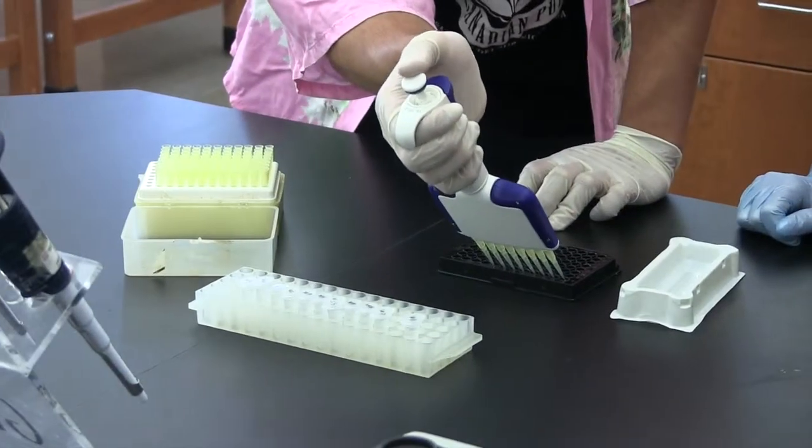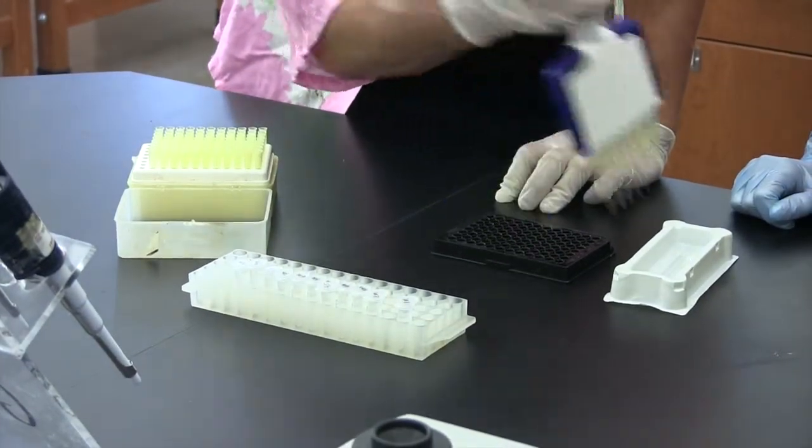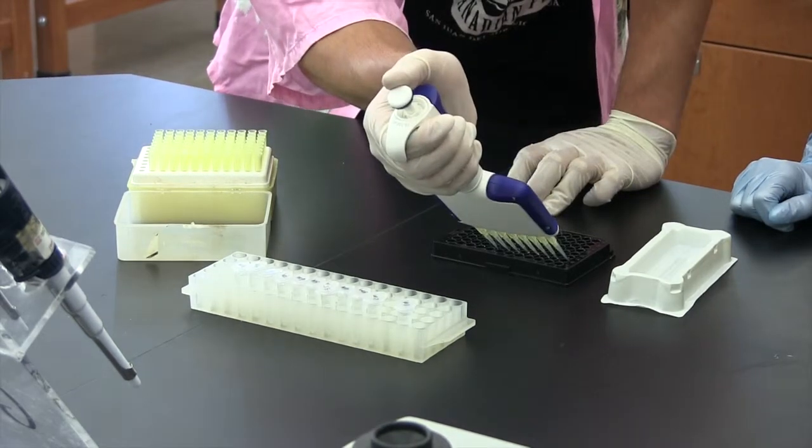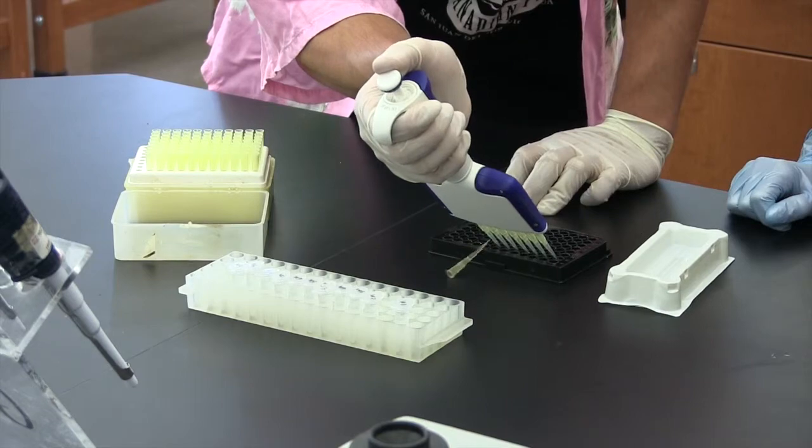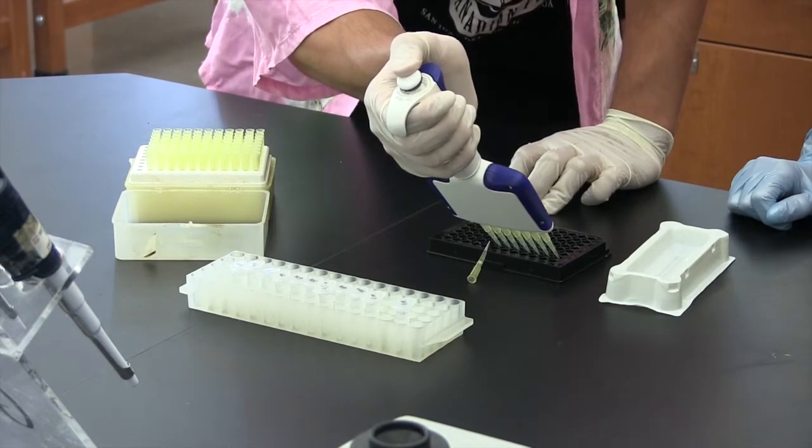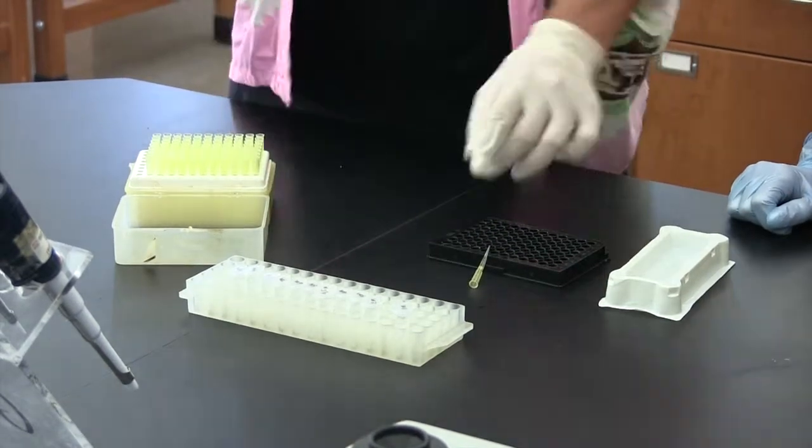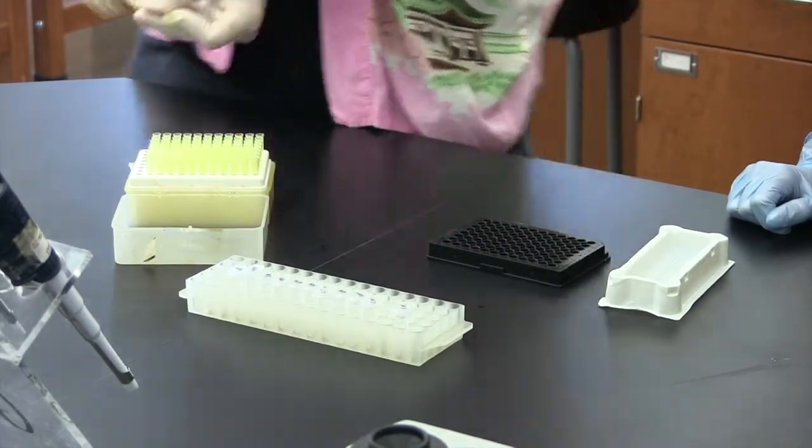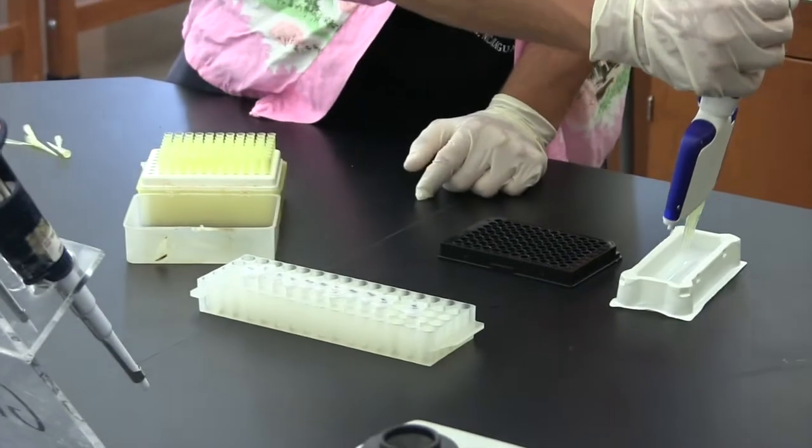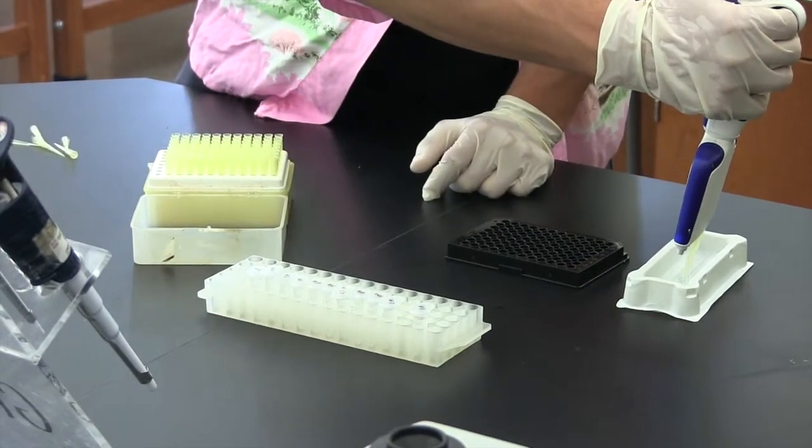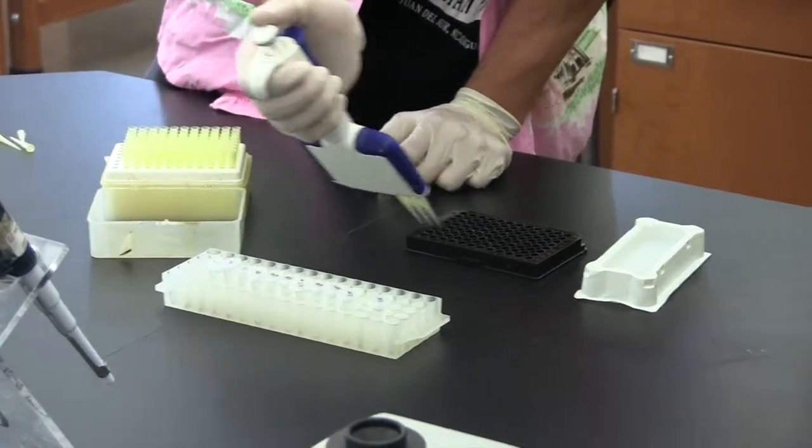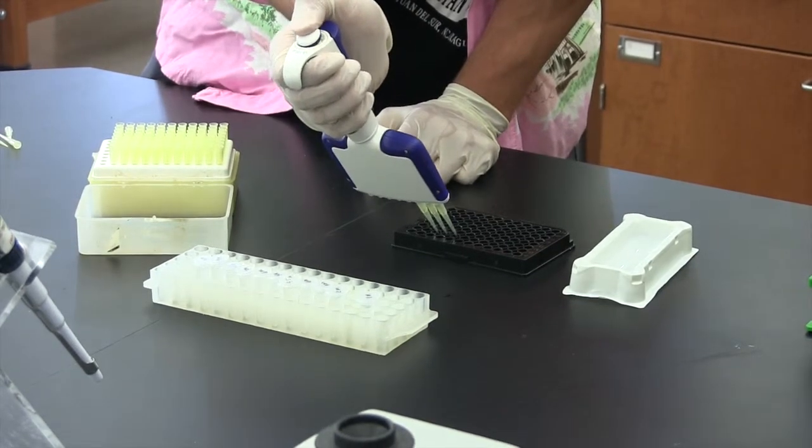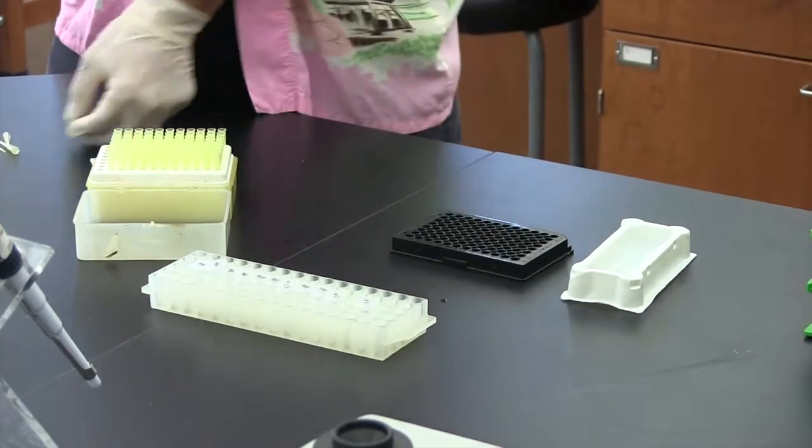Just go across to the plate. See, so there was a bad one. It's fine, you can just do one more. So then I'm going to need three over there. And then just two for this last one.